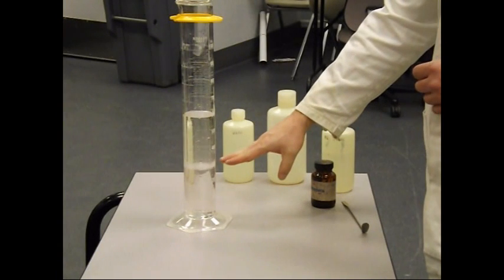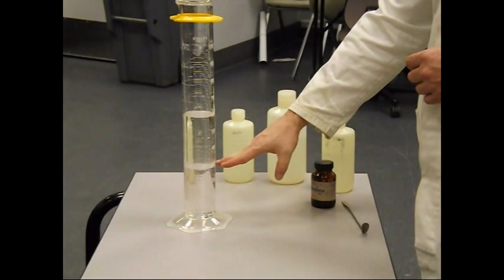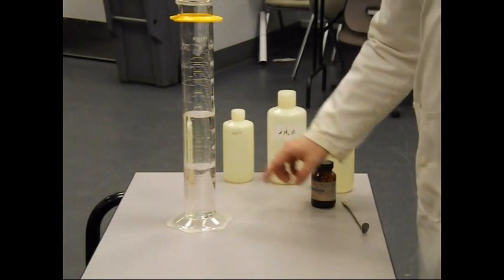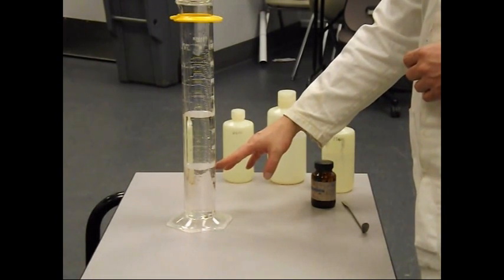Between dichloromethane and water, they are not miscible. So quickly you should be able to see a layer right about here in the video. Yeah, it's fairly obvious right there. So there's a layer there.